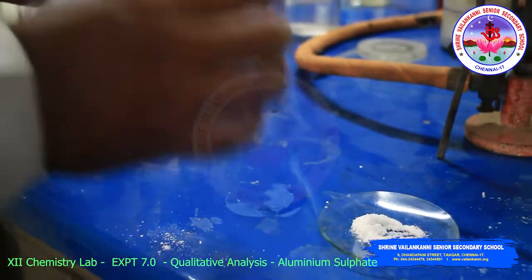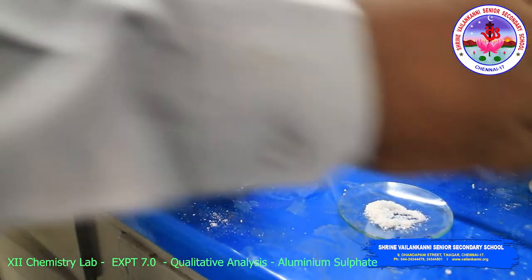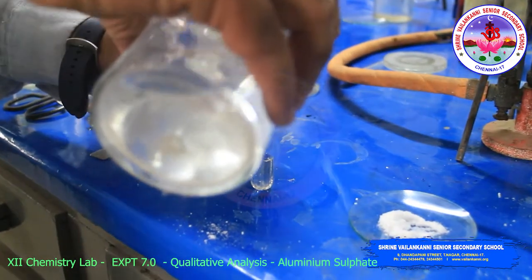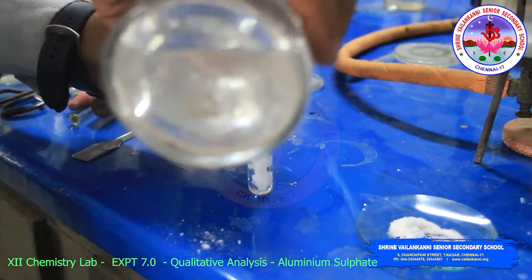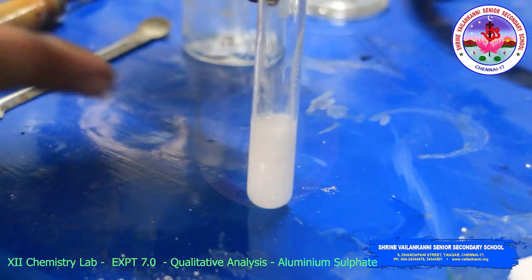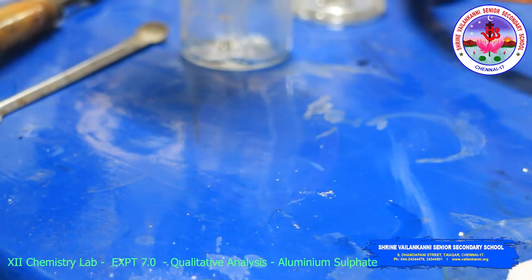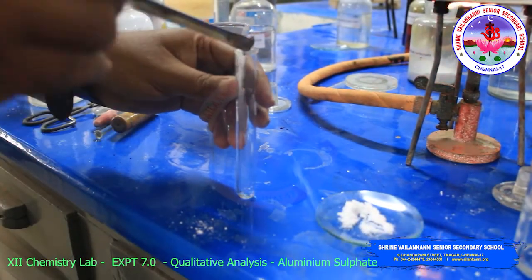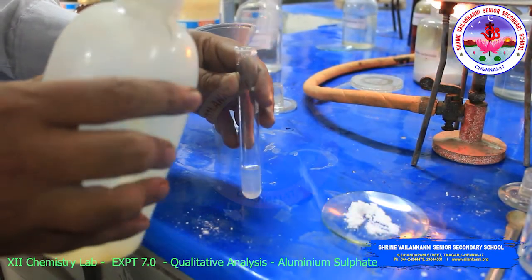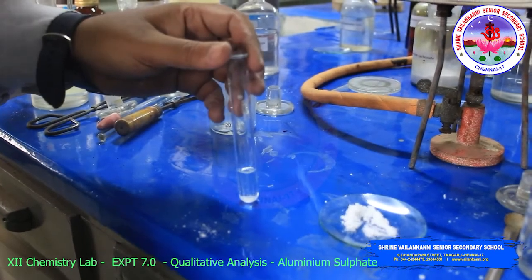To the filtered solution, add lead acetate solution. The white precipitate indicates sulphate is confirmed. So a white precipitate is obtained here, so sulphate is confirmed. Now we will do the basic radical. Prepare the original solution: take an amount of substance, add water and dissolve it with the help of the glass rod.